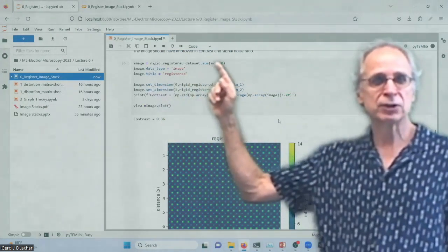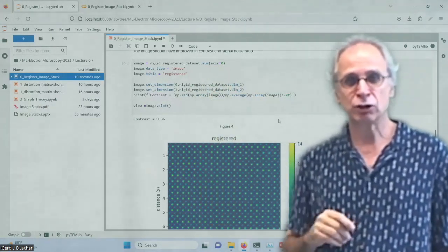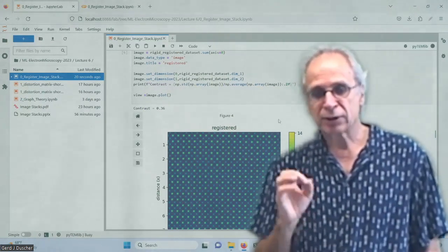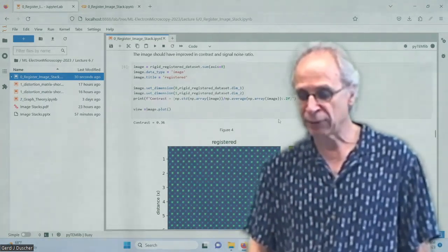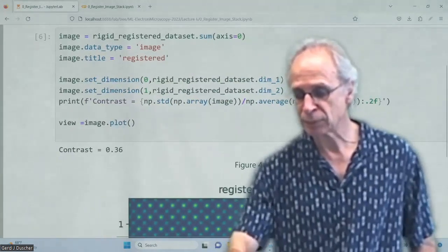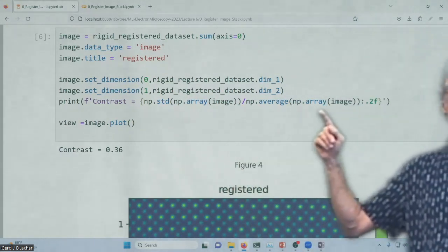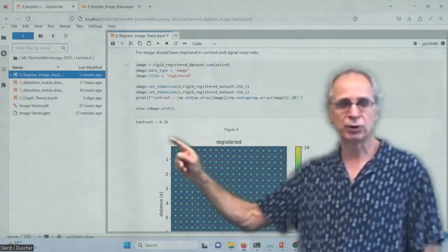So we sum this rigid data set. That's the advantage of the sidpy data set: all of these different functions that you used from NumPy are natively implemented, and you get back a sidpy data set that you can then just plot. What I'm interested in is the contrast. How good of a contrast did we get? And so we have to think about what is contrast. You can look at this definition that is usually used for contrast. It's the standard deviation of an image divided by the average of the image. That's what we usually use as contrast, and we get a contrast of 0.36.